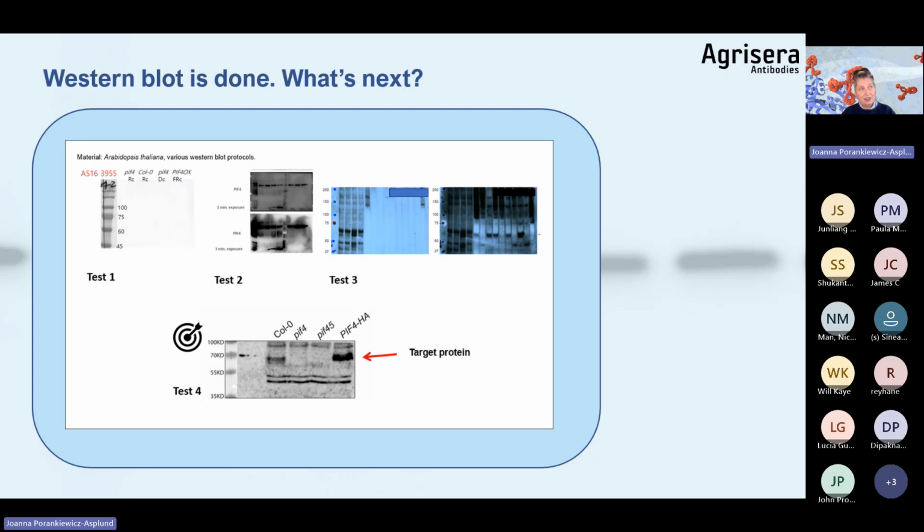And here you can see results from 4 different laboratories. The material was the same, Arabidopsis thaliana. Each lab received the same primary antibody, but as you see here, the outcome was very different. From no signal, to a lot of background, to one lab which managed to visualize the target protein. So this is because they use different protocols. Western blot is a technique with many variables, and therefore the outcome can vary depending upon the lab.